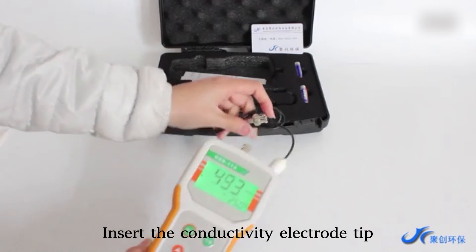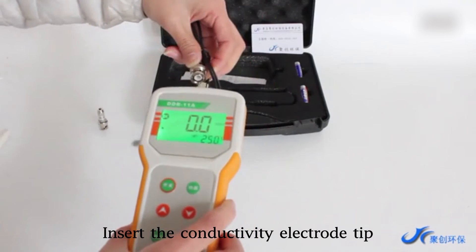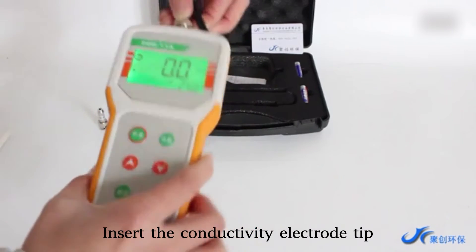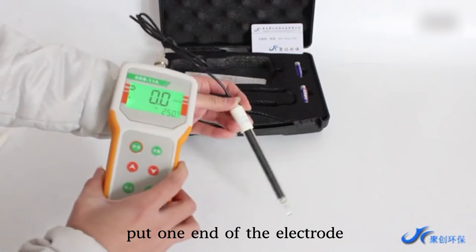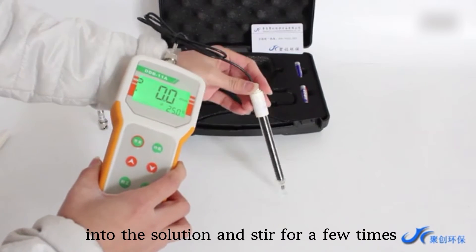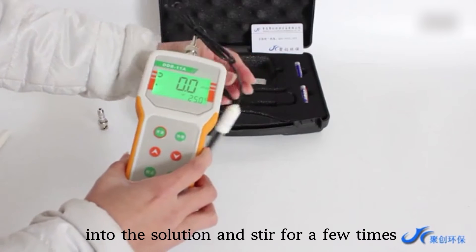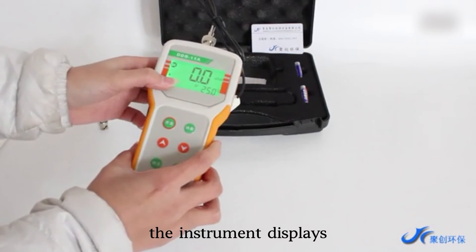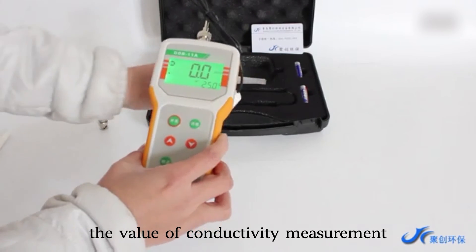Insert the conductivity electrode tip. Put one end of the electrode into the solution and stir for a few times. The instrument displays the value of the conductivity measurement.